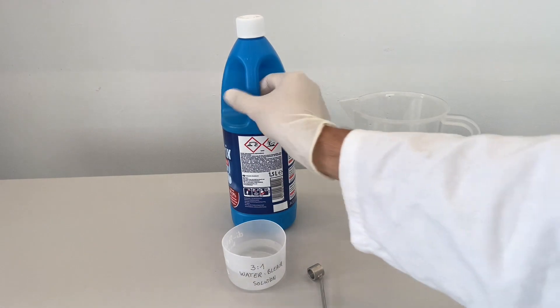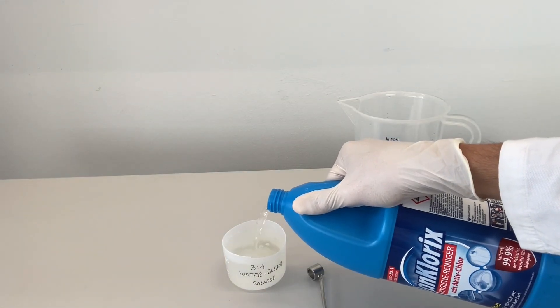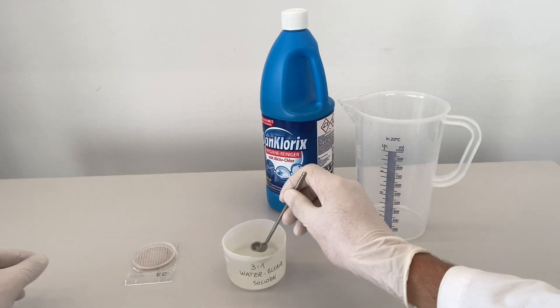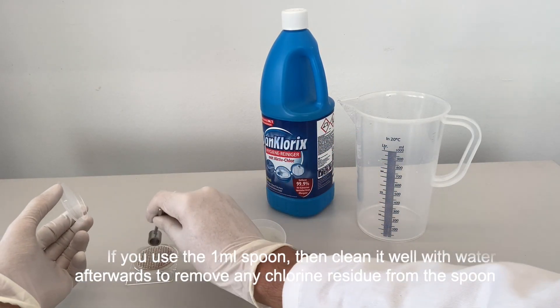Wear gloves and prepare a bleach solution of a ratio of three parts water and one part bleach. Open the dish and add one milliliter, then re-close.